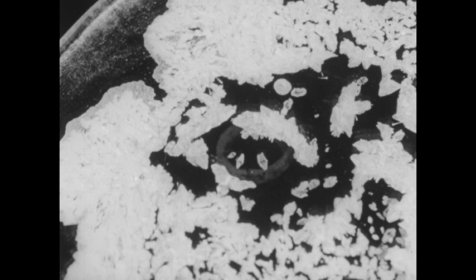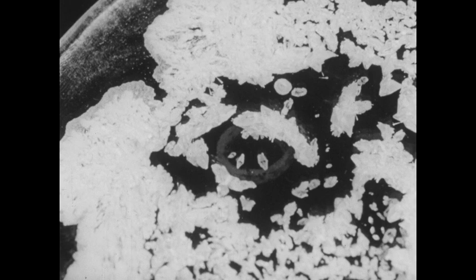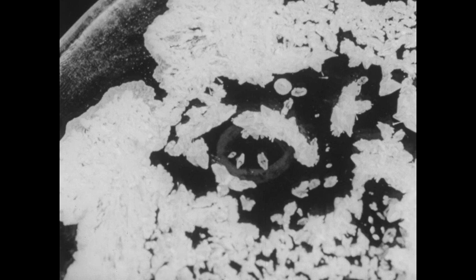The element sulfur occurs in several allotropic forms, of which at least two are common and well known. We are now looking at crystals of rhombic sulfur. These crystals have been obtained by dissolving a small quantity of sulfur in some carbon disulfide.